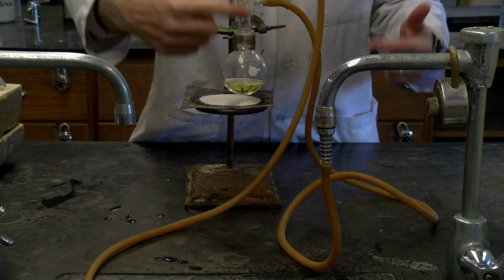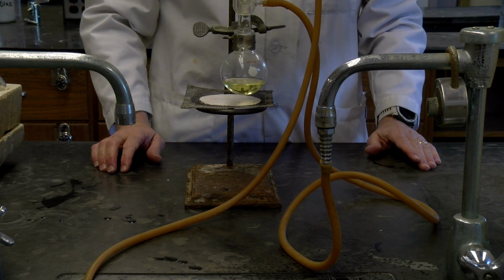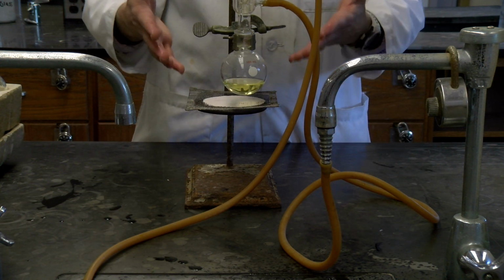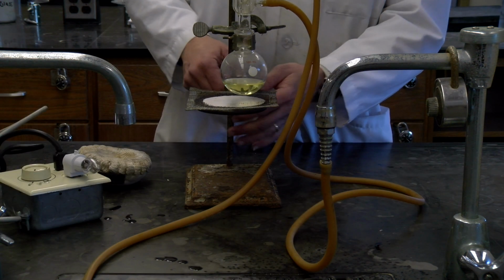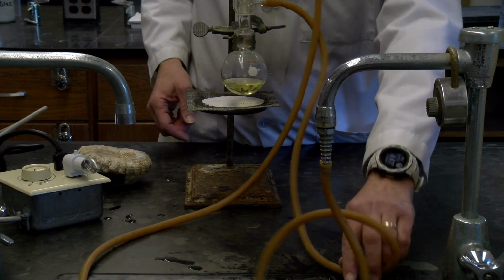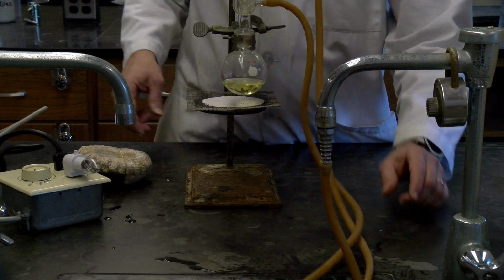All right, so allow this to circulate up and allow the water to work out. All right, so I'm going to get a heating mantle and we'll be back and we'll get this started heating. All right, so we've just about got this set up. Again, we've got our tubes already set, so we're going to probably keep those away from the heating mantle.